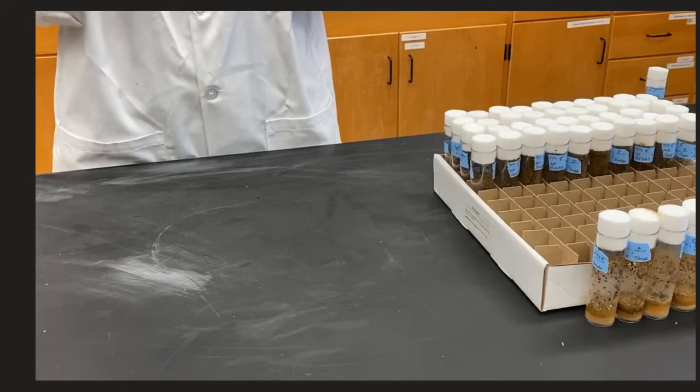Hi everyone! This video will walk you through maintaining fly stocks and lines in vials.